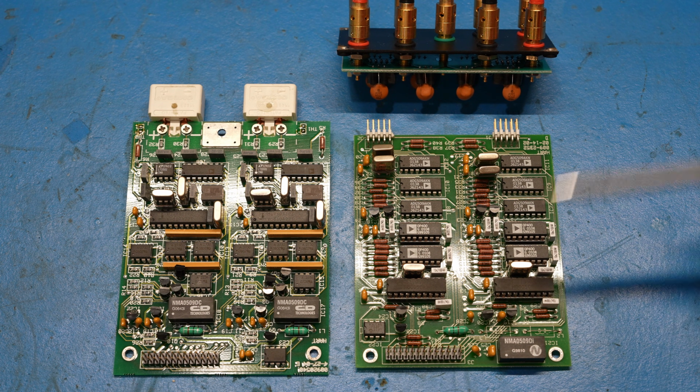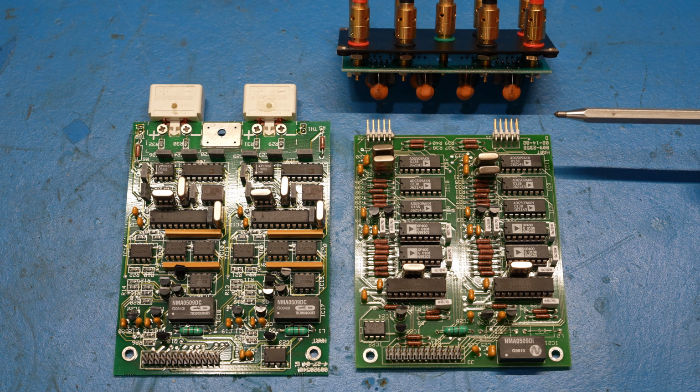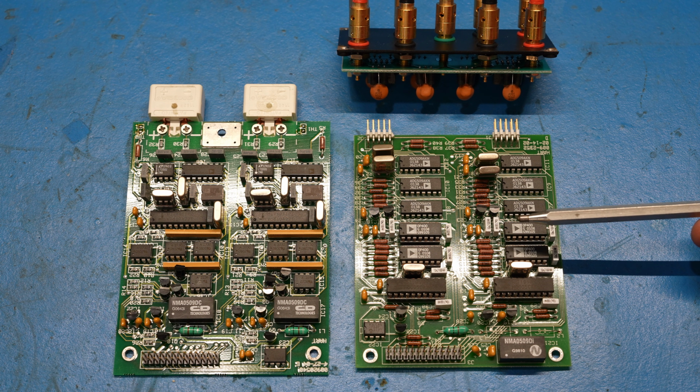Each of these modules has 2 4-wire measurement capabilities, which can read PRTs. These are resistive-based temperature sensors. This one doesn't communicate with the main CPU. It does get hot. Now, there is a working one in there. We could potentially compare it, figure out what's going on, and potentially even repair it.